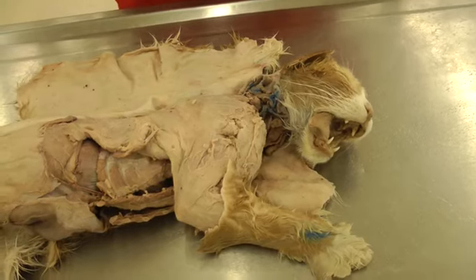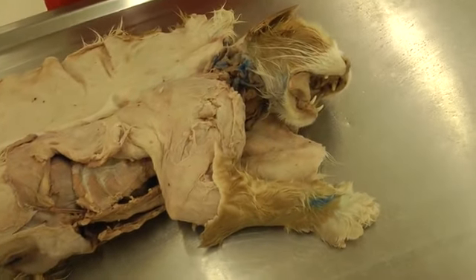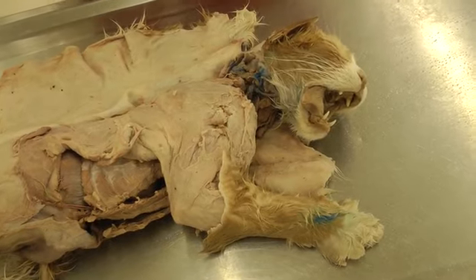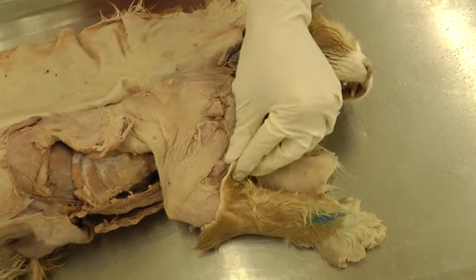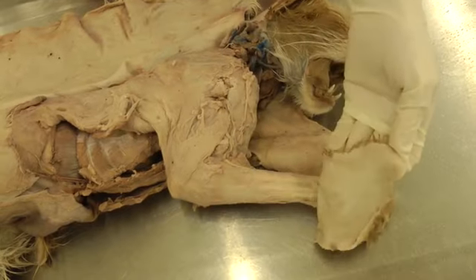This is lab 14 on the cat specimen. We're finishing up the thoracic limb — arteries, veins, and nerves — and you have to remove the skin from the rest of the antebrachium.